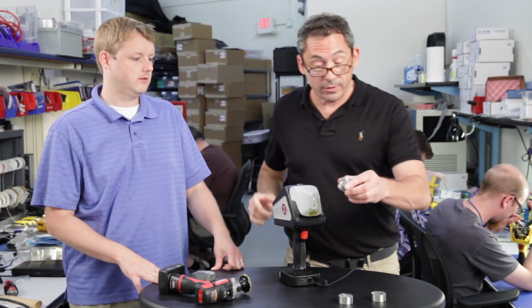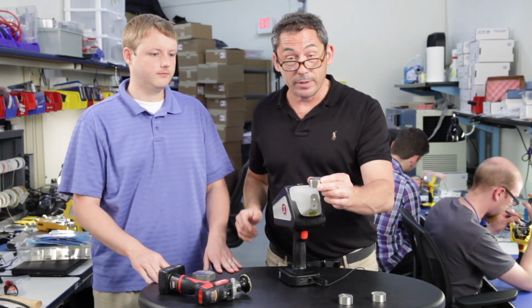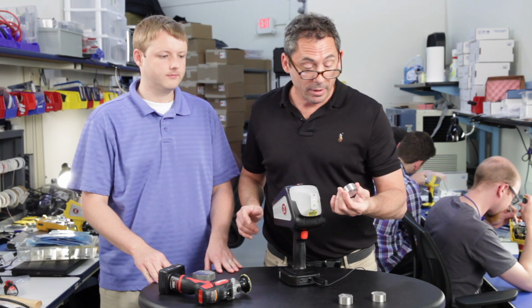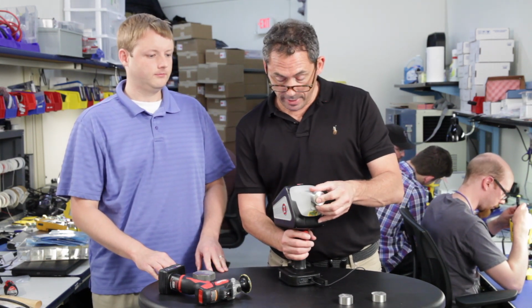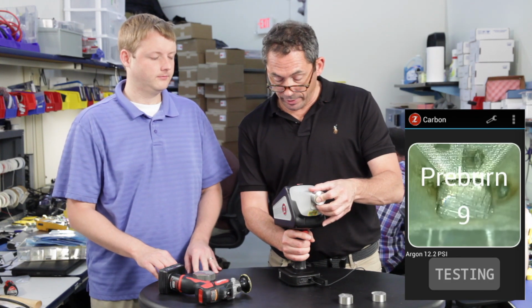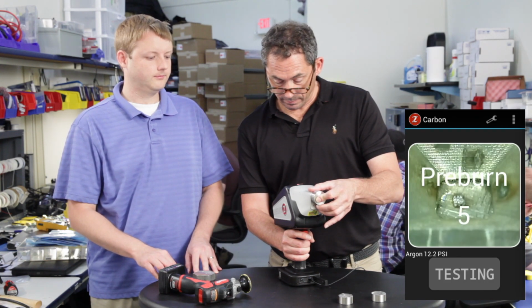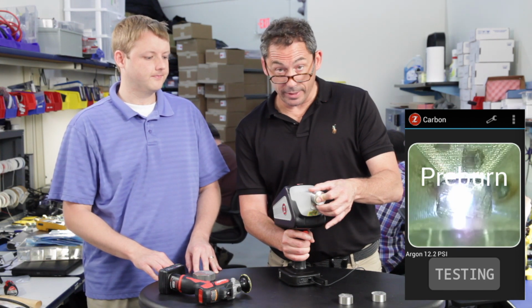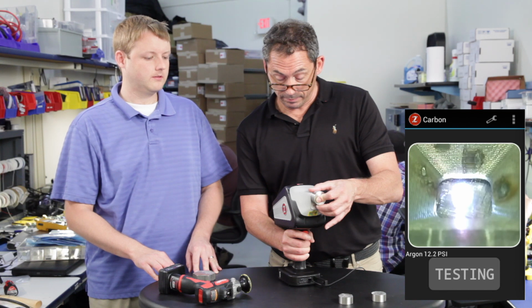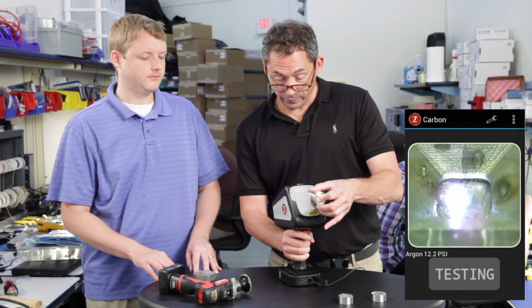Okay, so let's reshoot our 316 now, because I want to make a couple of points about some other elements, not just carbon. So yeah, let's do that. Here we go. We're getting our pre-burn. So it's a 6-second pre-burn after a 2-second pre-flush with the argon. And we'll get our first test.